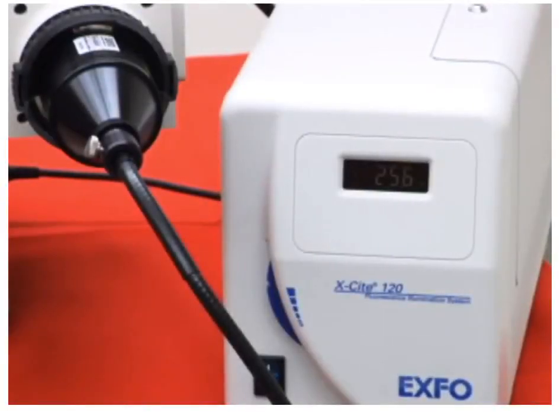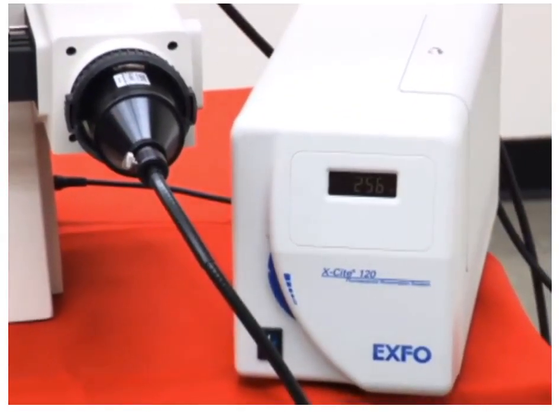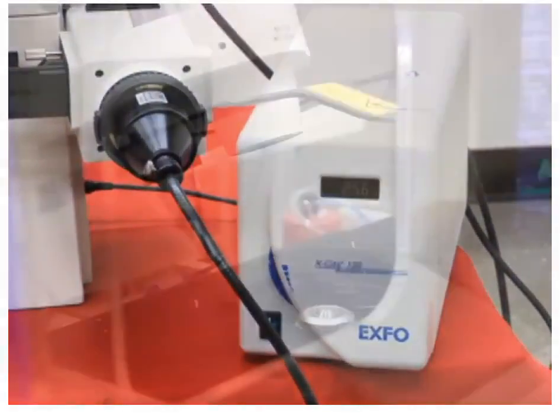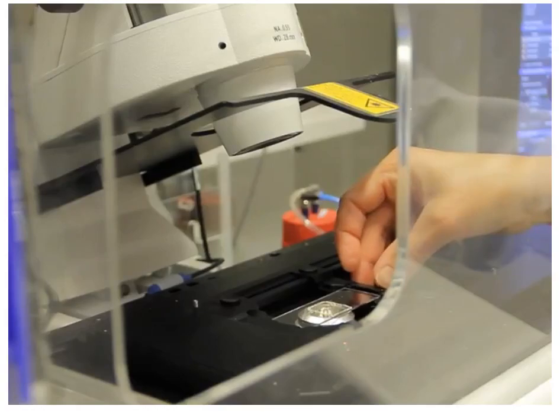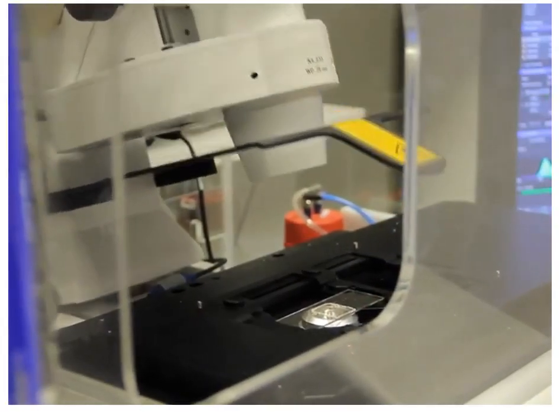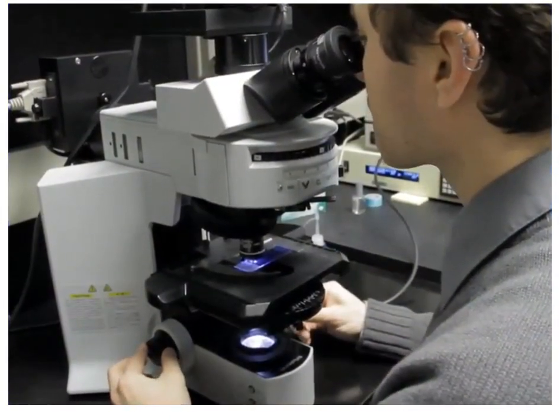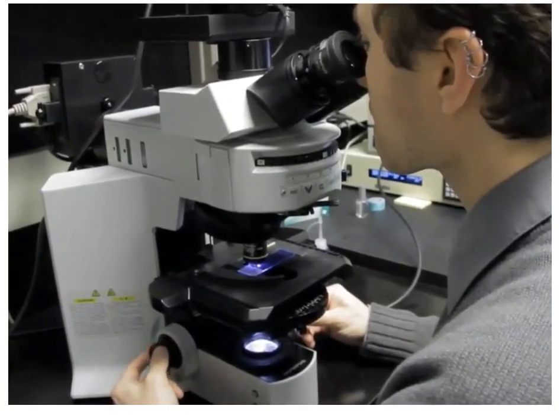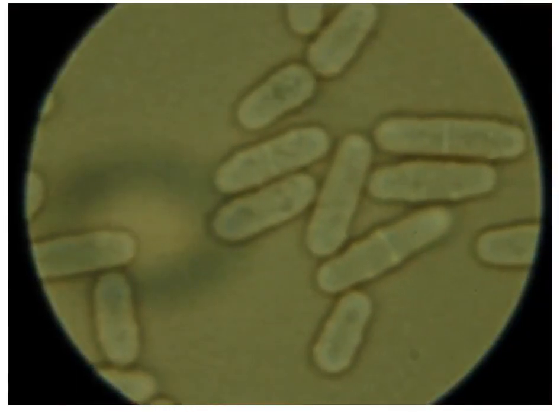To begin fluorescence imaging, turn on the xenon or mercury light source and allow it to warm up for as long as 15 minutes in order for it to reach a constant illumination. Next, place your sample onto the stage and secure it in place. Then turn on the white light source of your microscope. Focus on your sample using the lowest powered objective by adjusting the coarse and fine focus knobs. Then use a stage adjustment knob to find your area of interest.